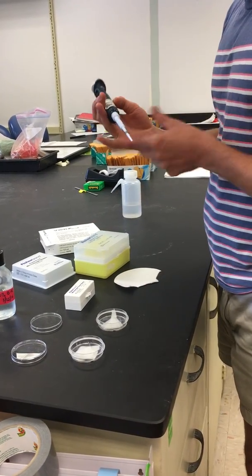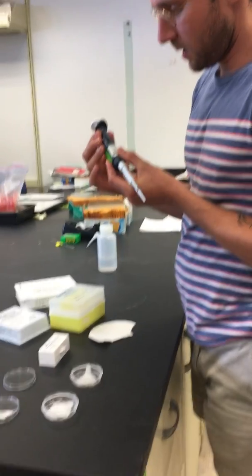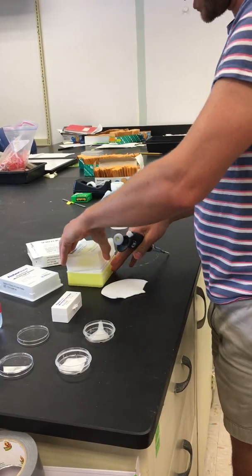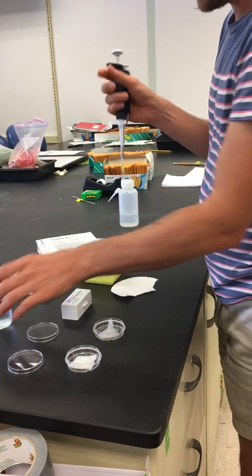Okay, so then I have a pipette set to 20 microliters.